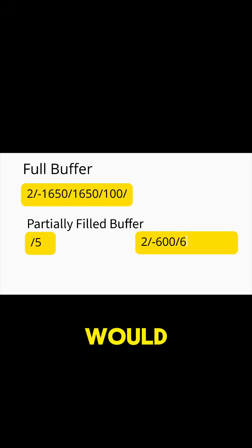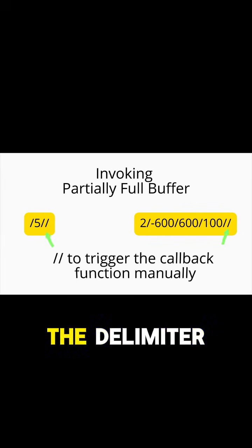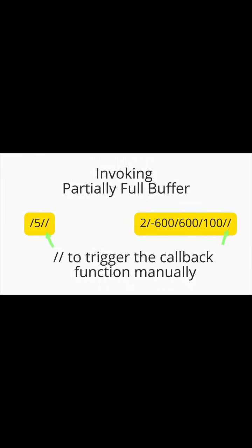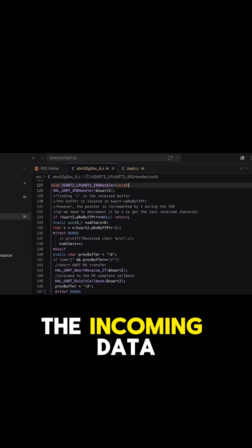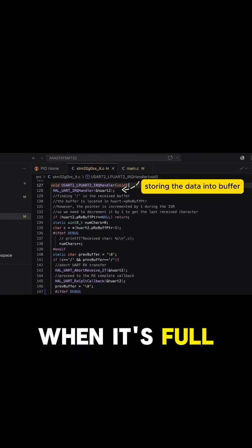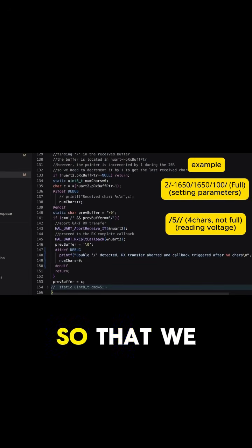The callback function would not be invoked if the buffer is not full. Therefore, we make double delimiter at the end as the condition to manually invoke the callback function. This is our UART interrupt handling code. The incoming data is stored in a buffer and would execute the callback function when it's full. However, we also add another condition to execute the callback function so that we don't have to wait for the buffer to be full first.